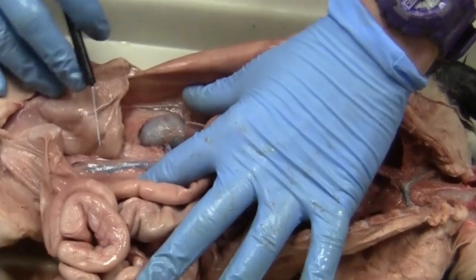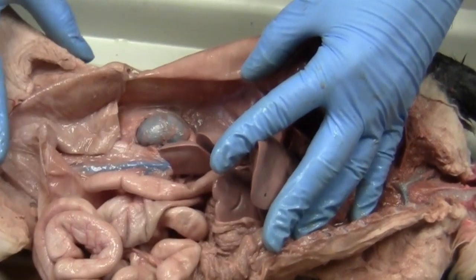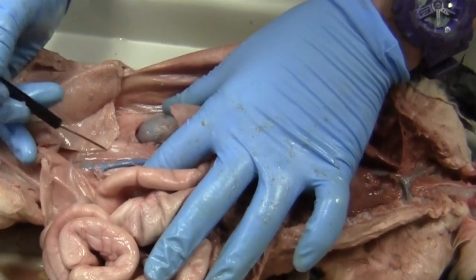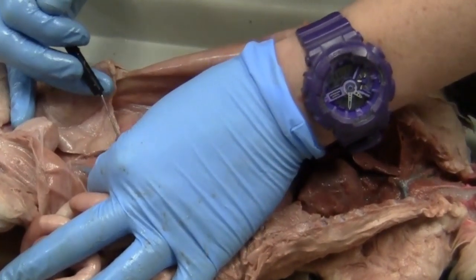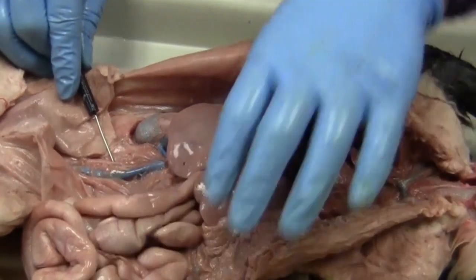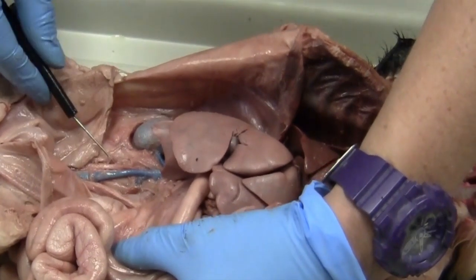Also, this big blue vein that's coming down here is a continuation of the caudal vena cava. The caudal vena cava is going to be bringing blood to the heart from the bottom half of the body. So it's a large vein. And then right next to it, I can clean this up a little bit, we're going to have another major artery that's going to be supplying blood to the bottom half of the body. So this is our aorta. It's an artery that, once again, supplies blood to the whole bottom half of the body. So you can always tell these are the two big ones. You have your caudal vena cava, and the aorta will lay right next to it.